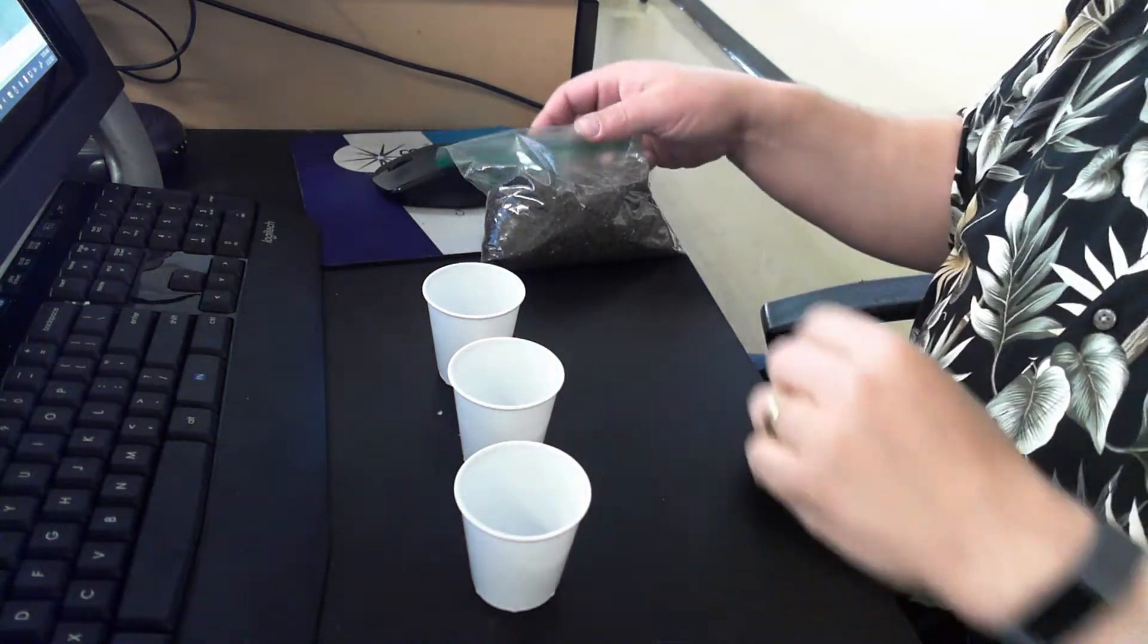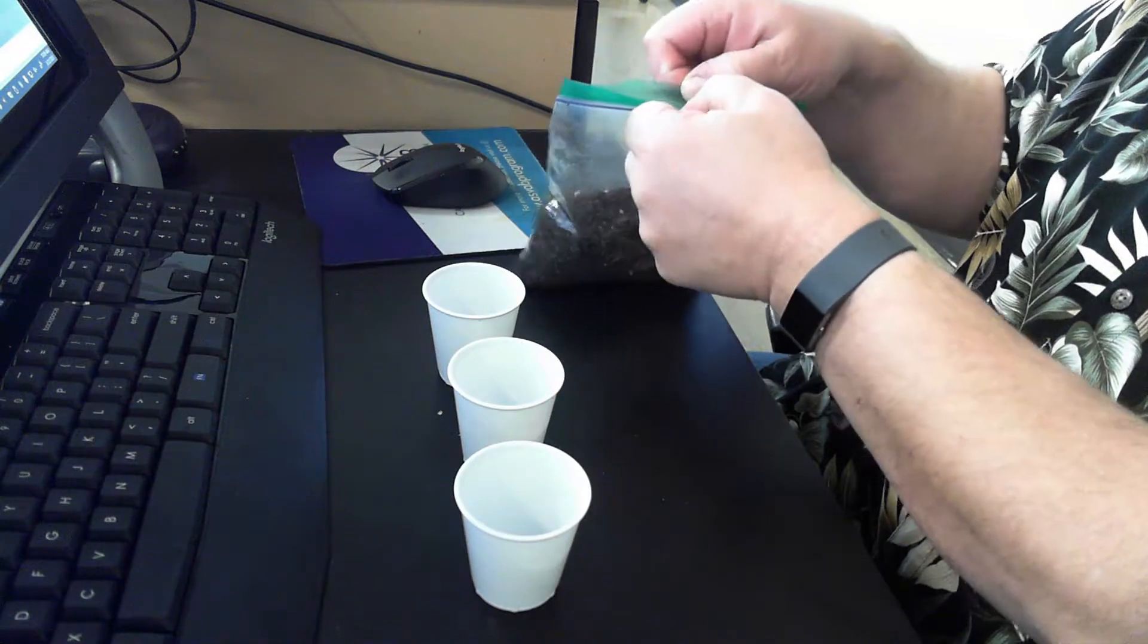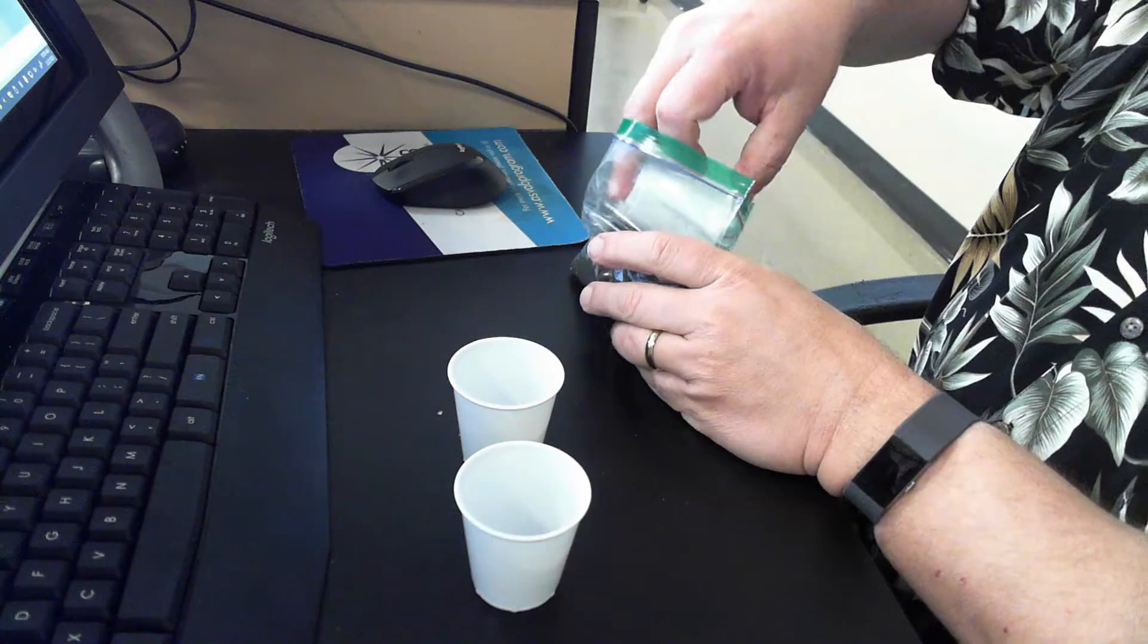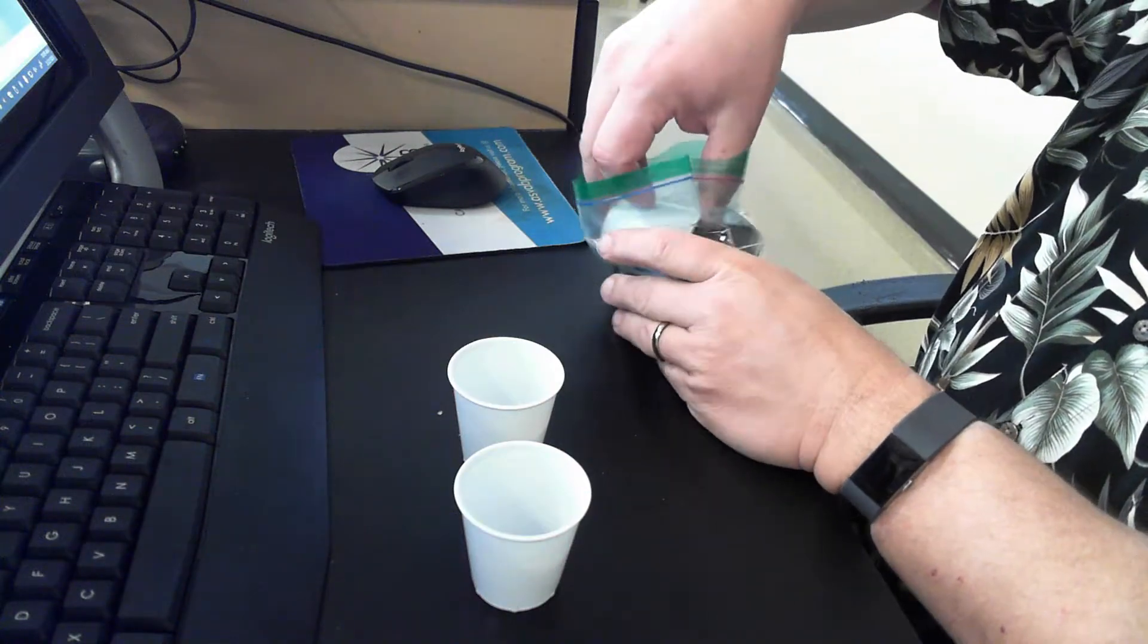So, first thing I'm going to do is, I am going to take my dirt, and I am going to put dirt in each cup.